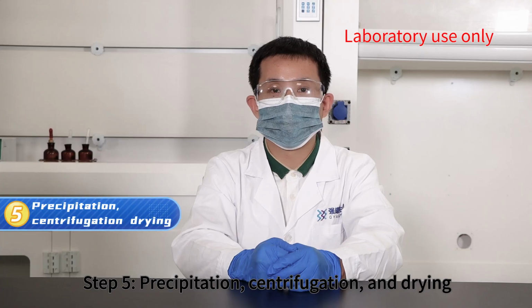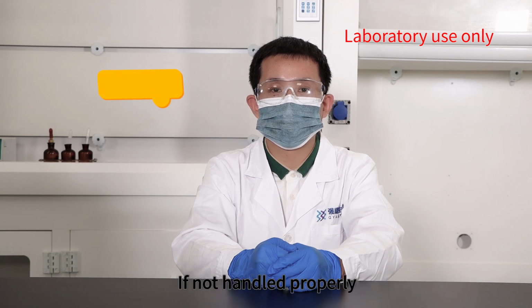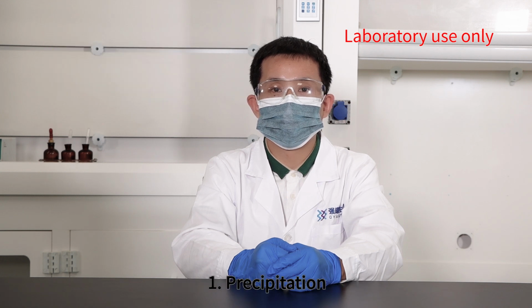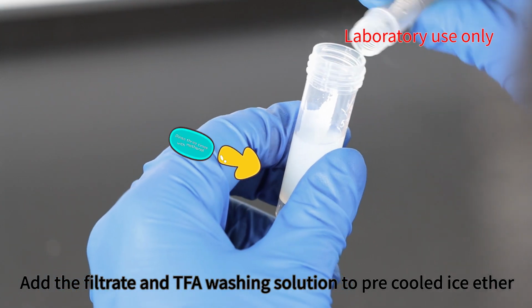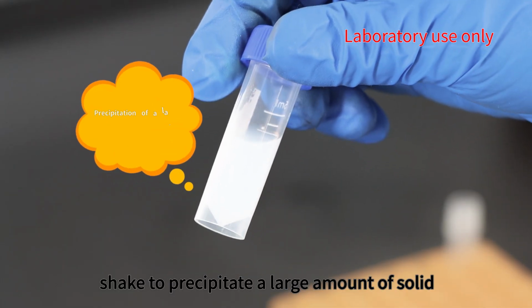Step 5. Precipitation, centrifugation, and drying. This step is the most important one that affects the yield. If not handled properly, a lot of peptides will be lost. 1. Precipitation. Add the filtrate and TFA washing solution to pre-cooled ice ether. Shake to precipitate a large amount of solid.